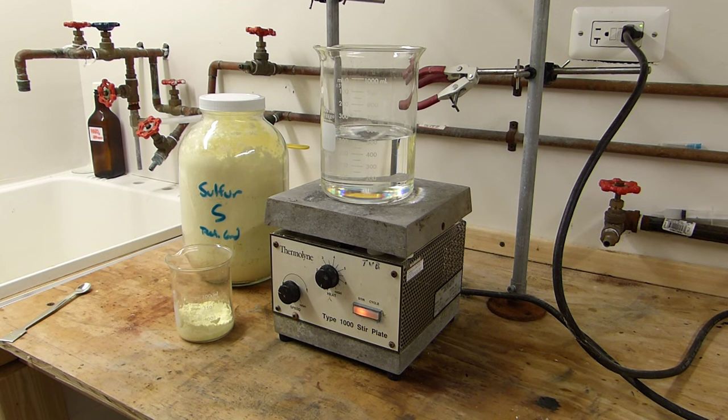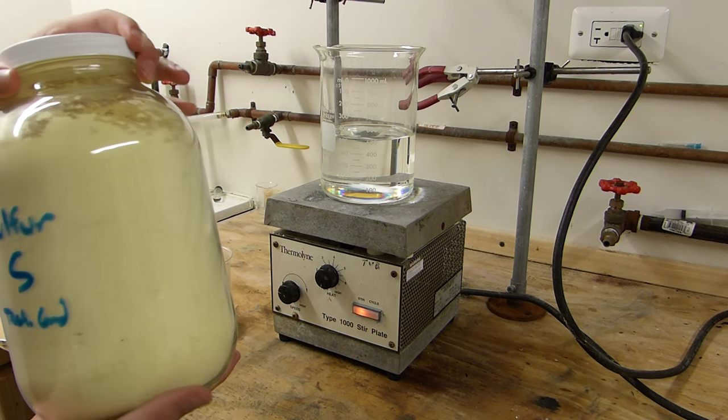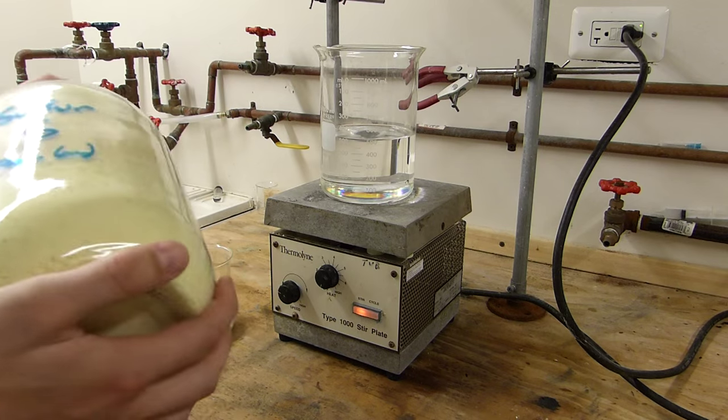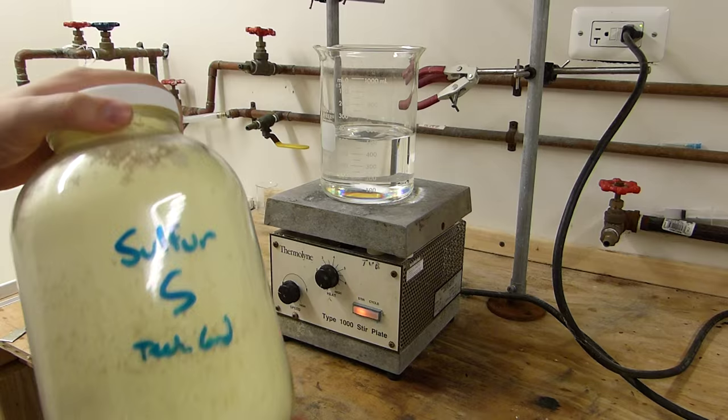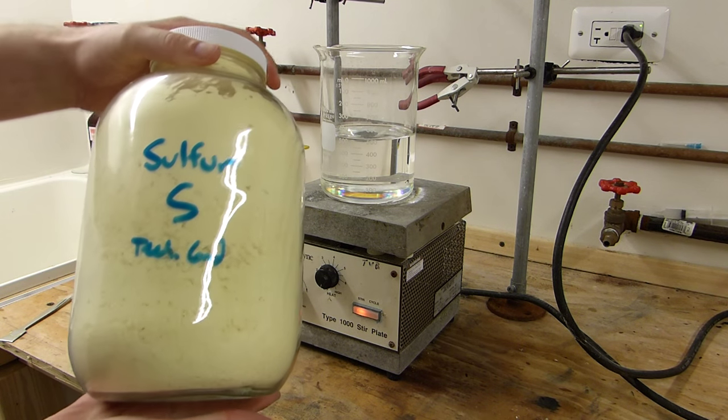Hi everyone and welcome back to the lab. In this video I'll be going over the purification of some sulfur here. I've got technical grade sulfur that's 99.9% sulfur according to the manufacturer, but I can't really be too sure because I just bought it on eBay. So before I use sulfur for some applications that require higher purity, I typically recrystallize it.